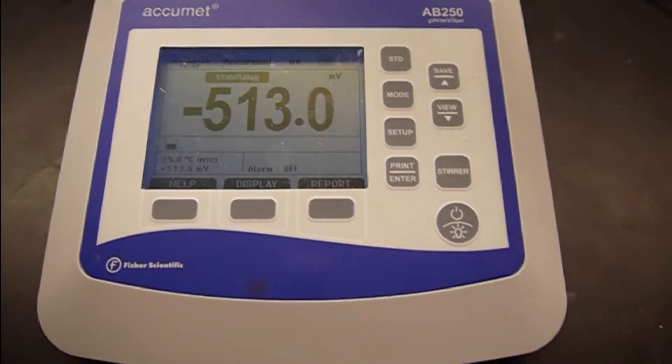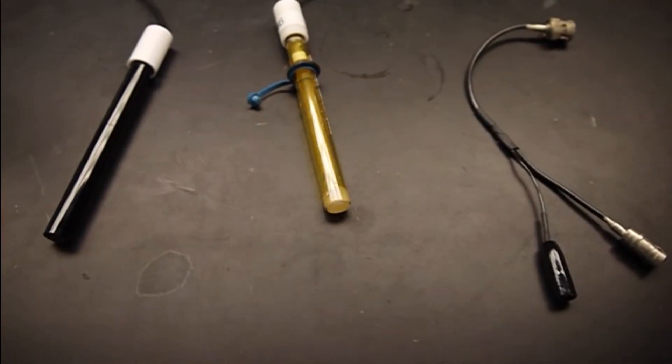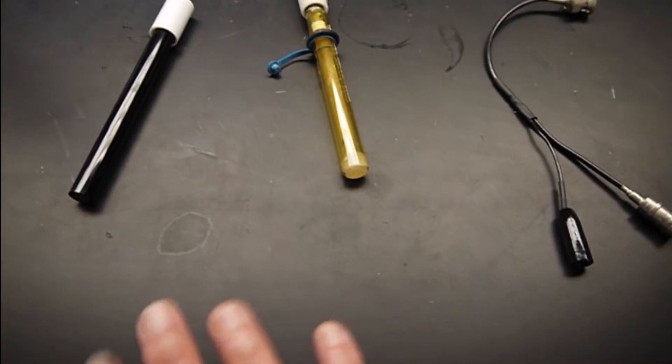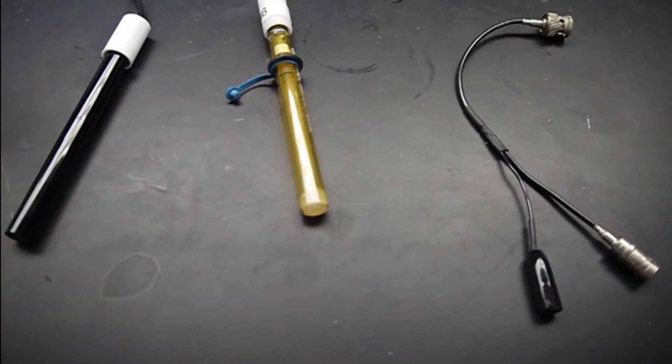This isn't going to measure anything right now because our electrodes are not plugged in. But first, before I plug in the electrodes, I need to fill up the silver silver chloride reference electrodes with the proper solutions.